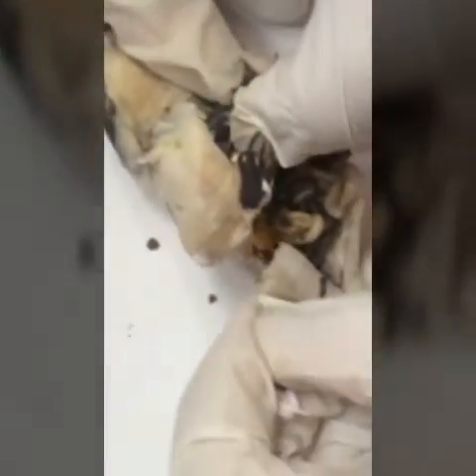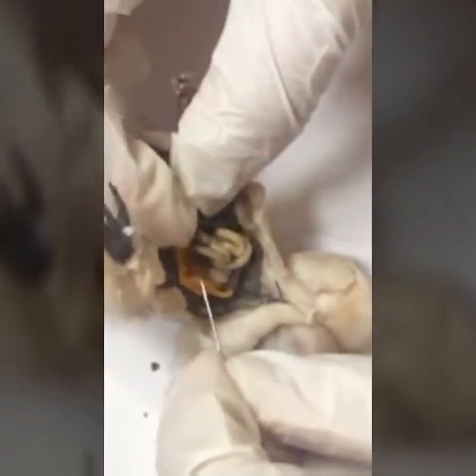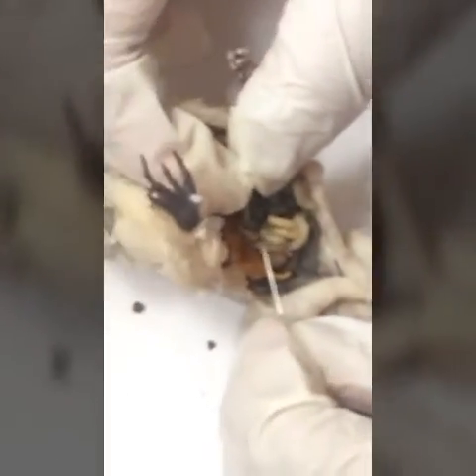Then you can see the kidneys right there. Then the last part is the anus, which is the hole that leads to the outside of the body.